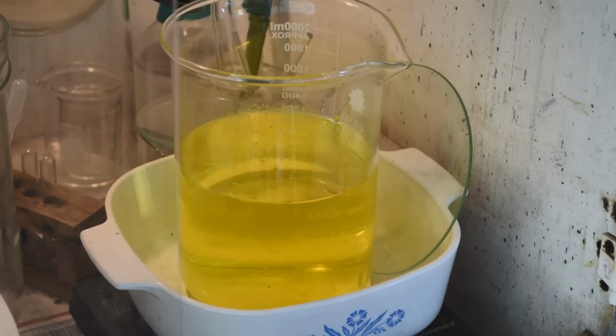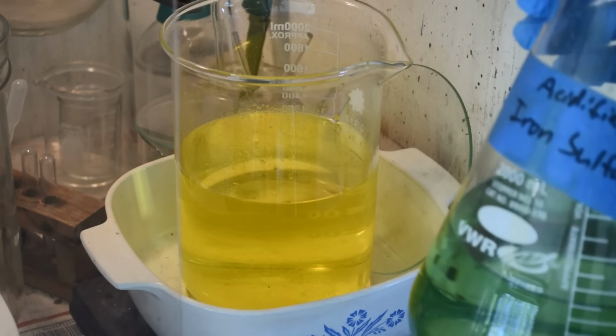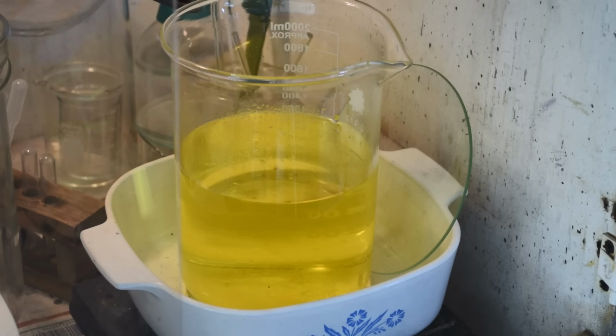All right, it's time to drop the gold and see how much we got. So I'm going to use iron sulfate for that. I've got some acidified iron sulfate solution here. Use it to drop the gold.